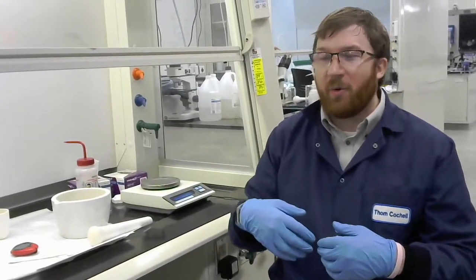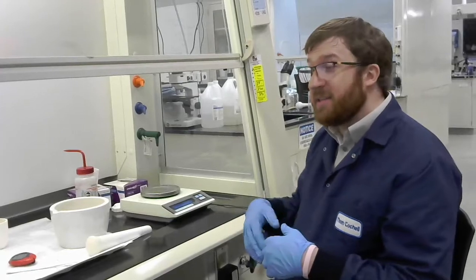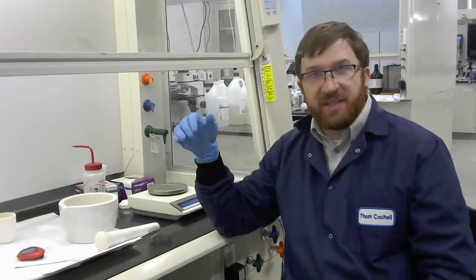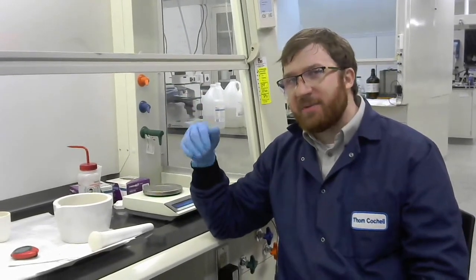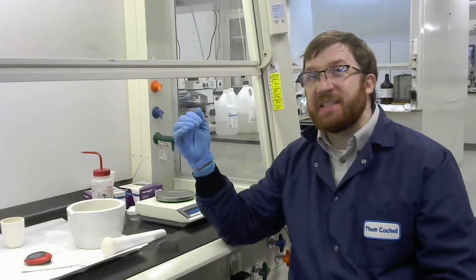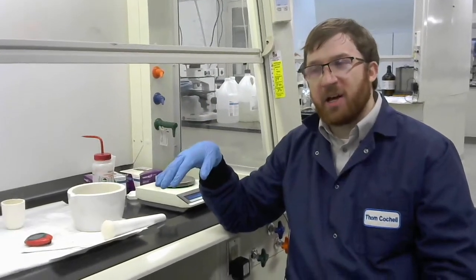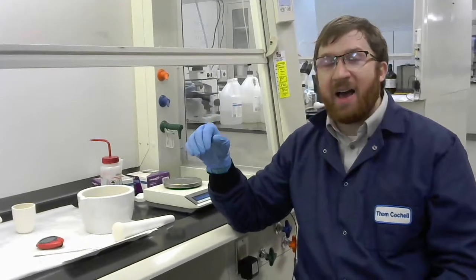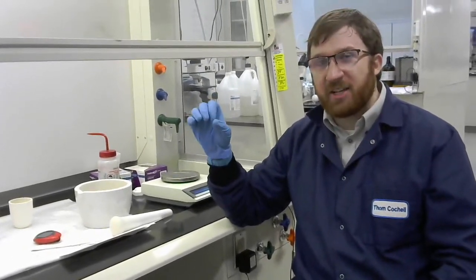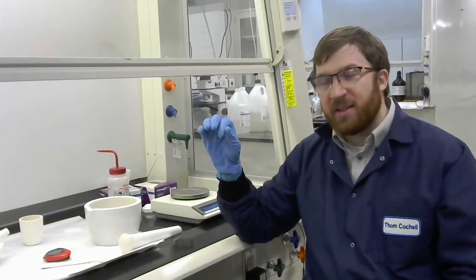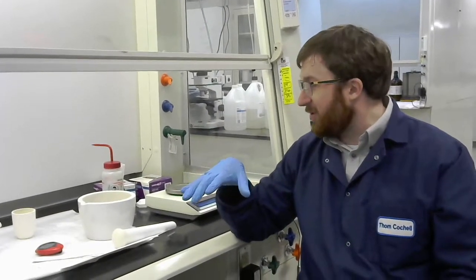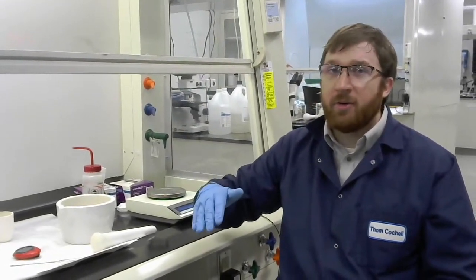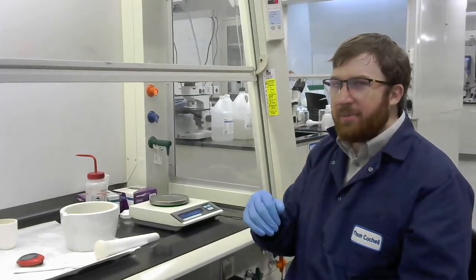In this case I'm not going to be timing myself 20 minutes like I did last time. But I am going to start the stopwatch just so you have an idea of how long it takes. Mostly because I want to want you to appreciate how much time me and Antonio spent here in the lab under quarantine. And then once we get to a point where we think the powder is reasonably fine what we're going to do is test it. So we have a series of sieves and so we can pass this powder through those sieves and we can see if it passes through the one that we want to go to. If you remember from your handout we are trying to get to 325 mesh.